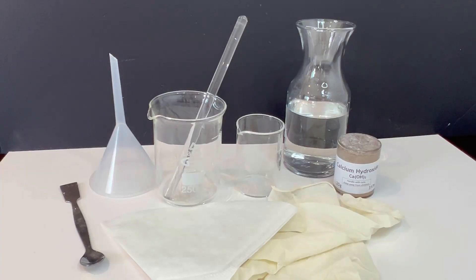In this lab session, we are going to learn how to prepare lime water, which is a saturated solution of calcium hydroxide in water. This solution is commonly used to test for the presence of carbon dioxide gas. Let's get started.